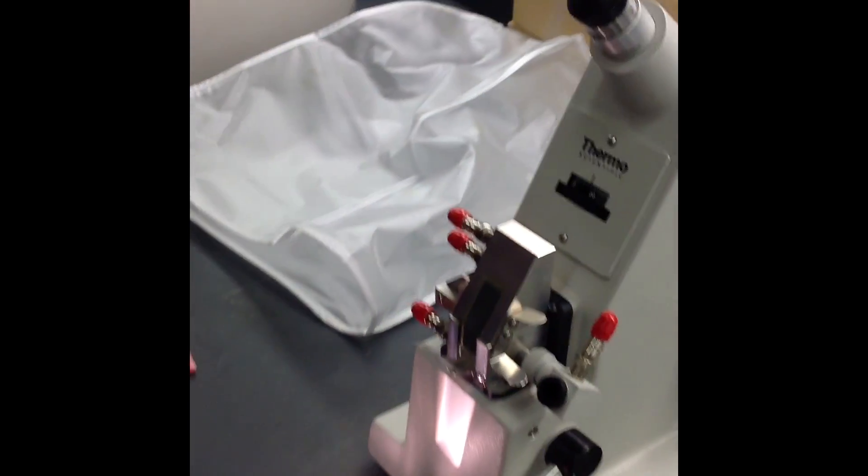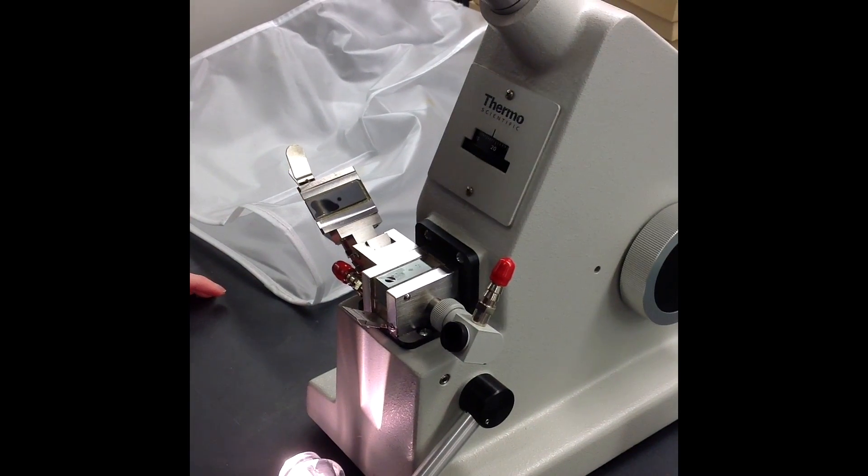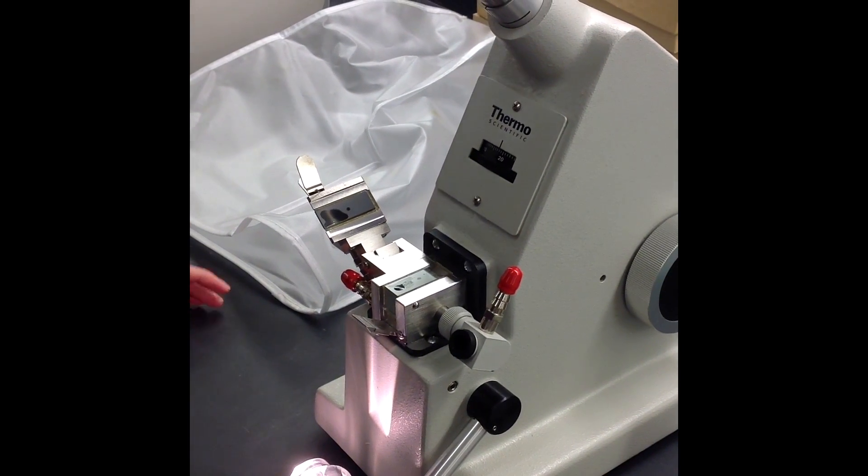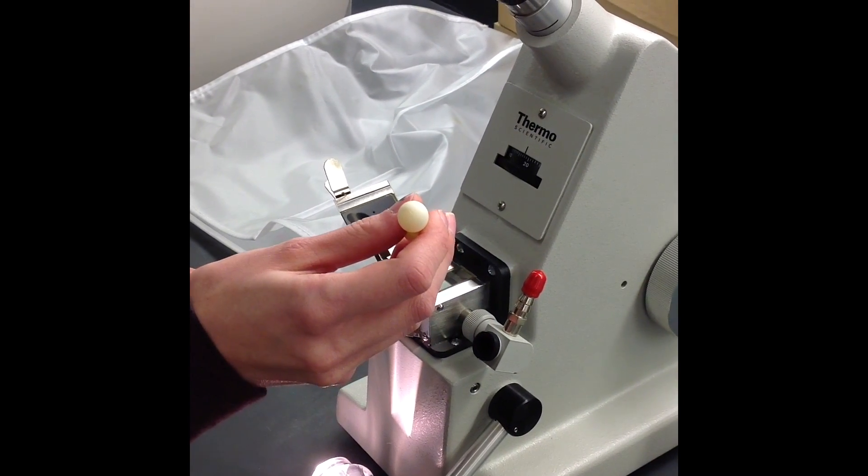I'm going to lower this, lift this up, and now I'm able to apply my sample. You should have your sample in a Pasteur pipette, and I'm going to add only a couple drops.